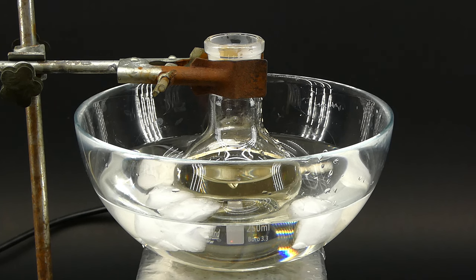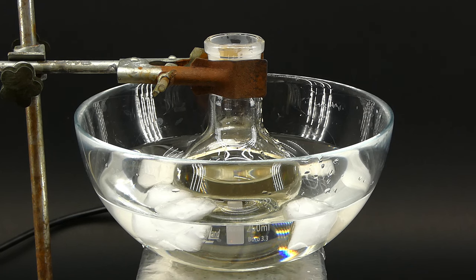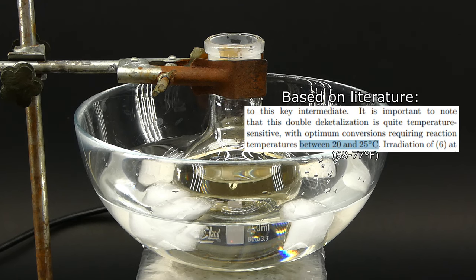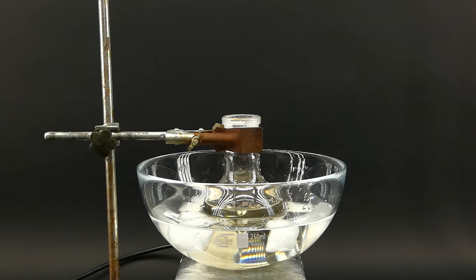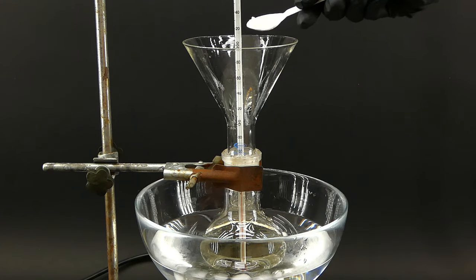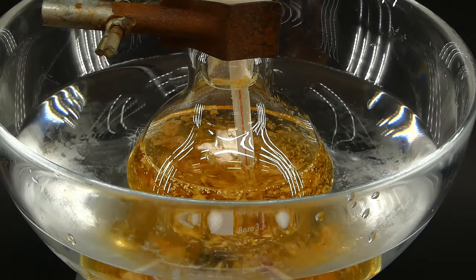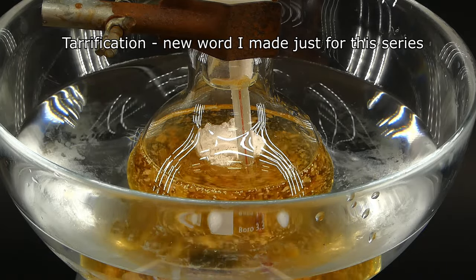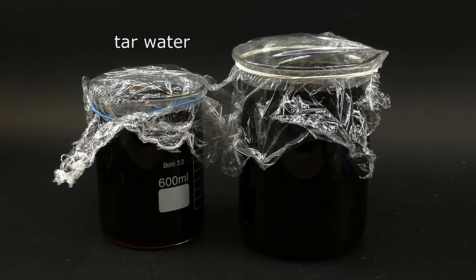I cooled everything down in an ice bath because this reaction produces some heat. The best temperature for this reaction is 20 to 25 degrees Celsius, and anything much above or below that will probably make the whole thing go into the tar. When everything was ready, I installed a funnel and a thermometer, and started adding the diketal in small amounts over about half an hour. It slowly dissolved and reacted with the acid, and the mixture started getting very yellow, indicating the start of the tarification process — but after what I went through in the past two episodes, this doesn't bother me too much anymore.